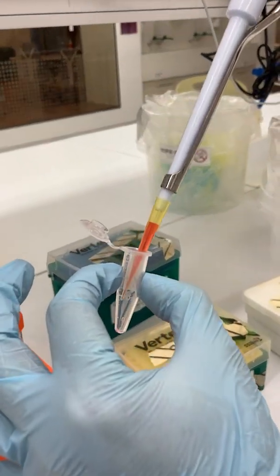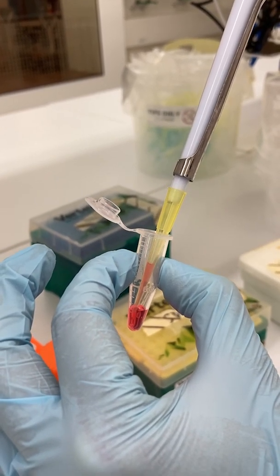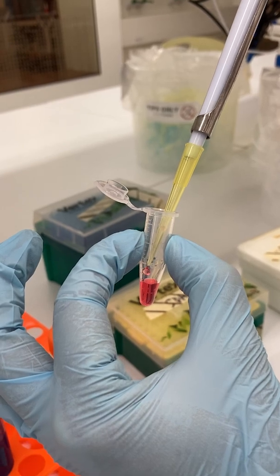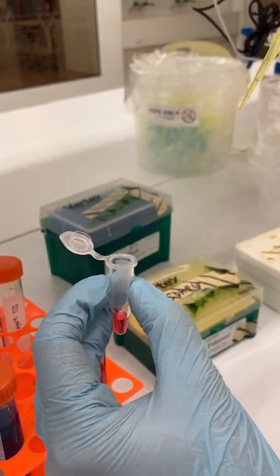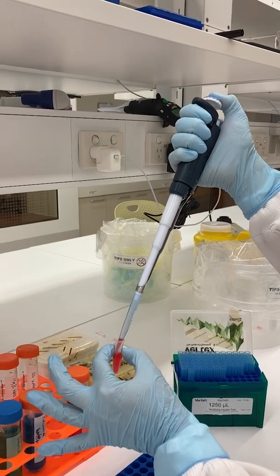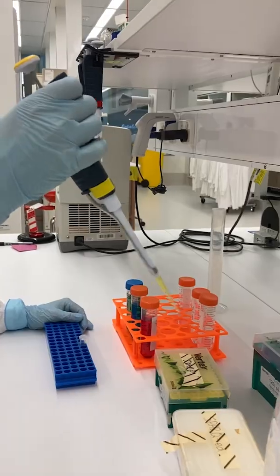Place the tip of the pipette into the container you wish to fill. Then steadily depress the plunger until you reach the second stop. This forces a small amount of air out behind the liquid, ensuring that the tip empties cleanly. If a droplet hangs at the end of the tip, touch the tip to the inside of the container. Remember to hold the plunger down until the pipette is out of the container. Otherwise, you may accidentally draw up the solution again.